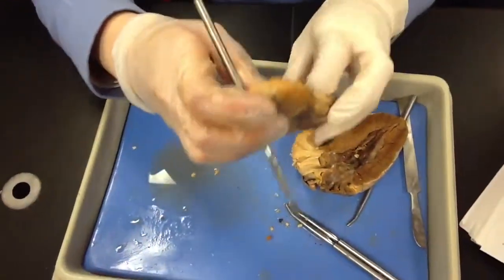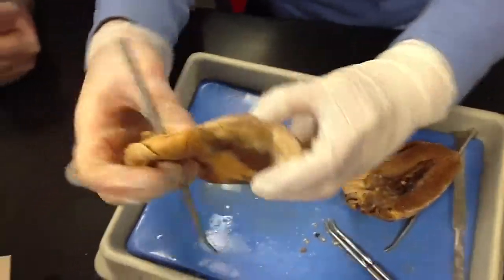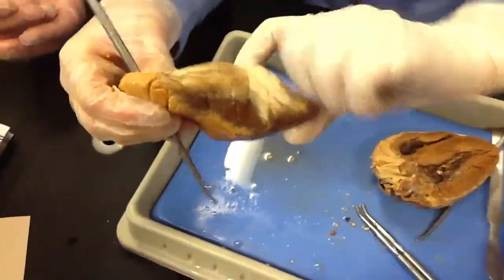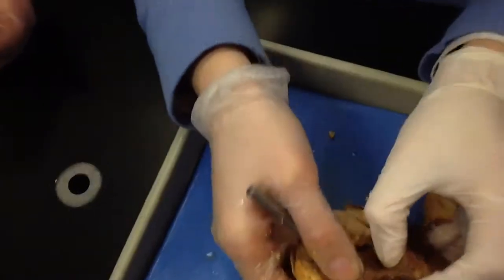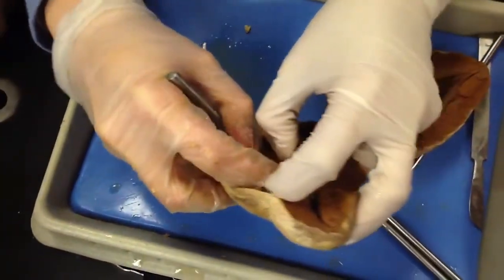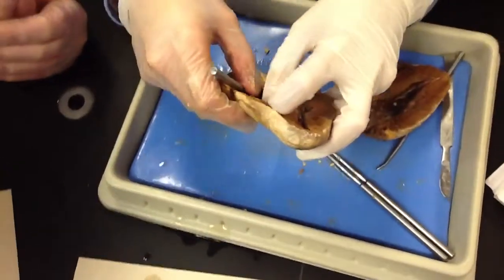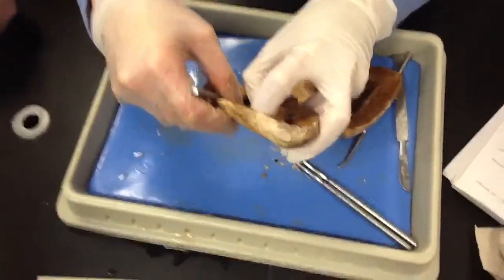Oh yeah, because the valves are what I'm hearing is identifying the right ventricle. Where does it start? Where does it end? Okay. So basically, you're looking in between the valves. Do you see those valves? Like there's the valve right there. Okay, that's the valve. Yeah. So atria, ventricles. It's the valves that separate them.